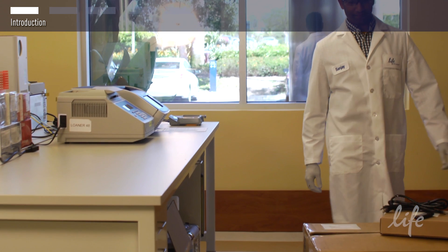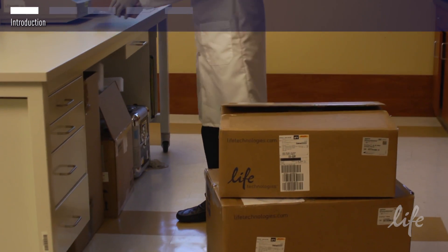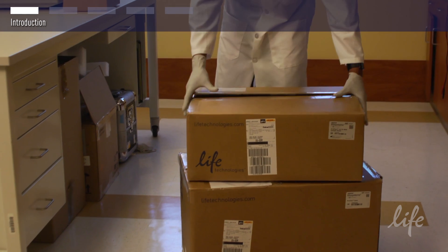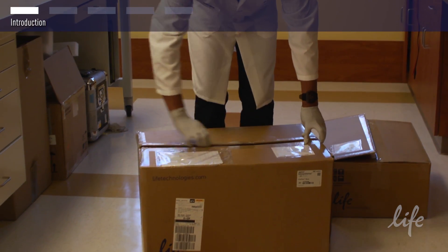In this video, we will show you how to quickly assemble your ProFlex instrument on the bench, turn it on, create a user, select a protocol to run, conduct that run, then save it for documentation and future use.